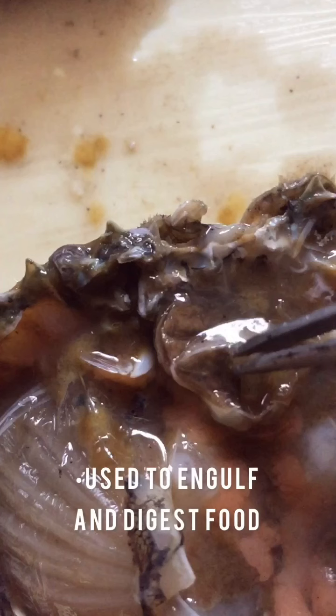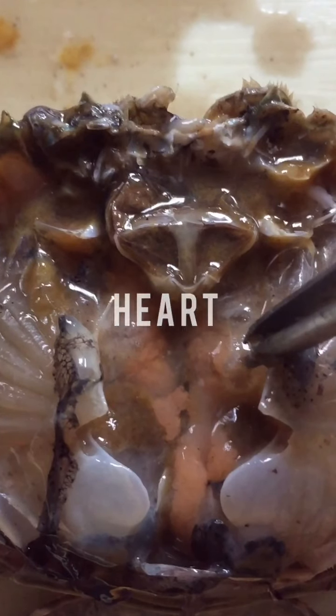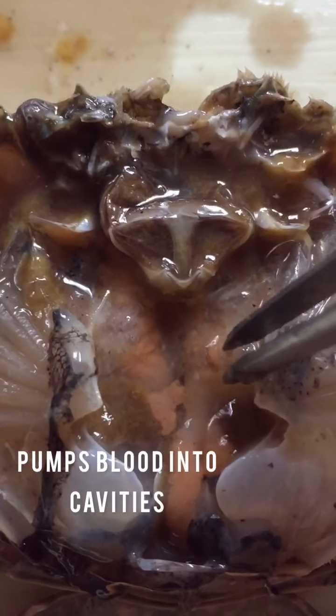We also have the gills, which absorb oxygen from water. Next is the cardiac stomach, which is used to engulf and digest food. We also have the ovary, which is used for reproduction. A crab also has a heart — they have an open circulatory system that pumps blood into sinuses or cavities.